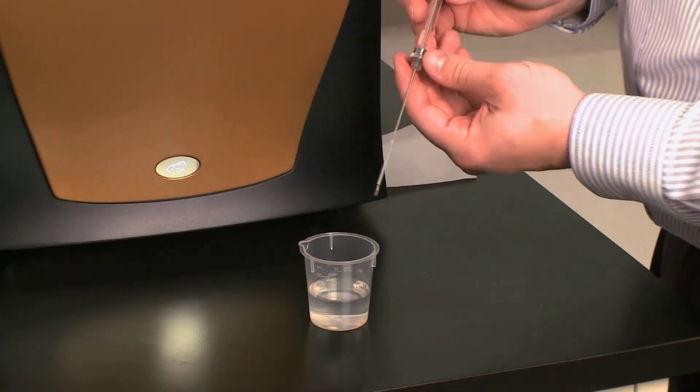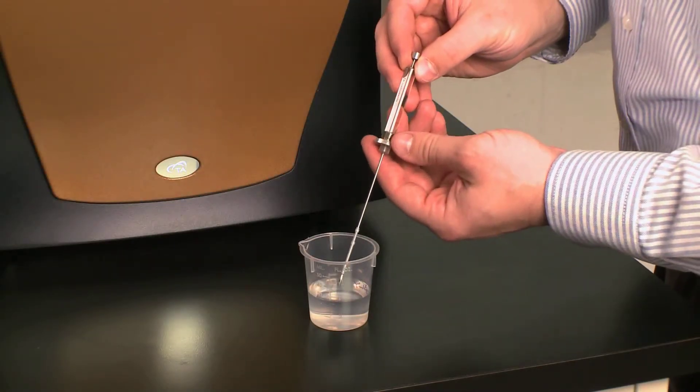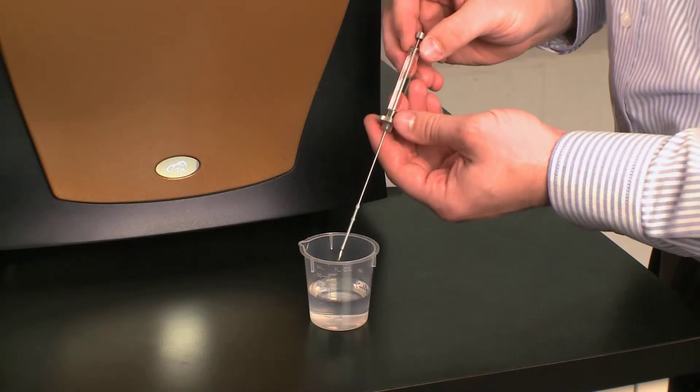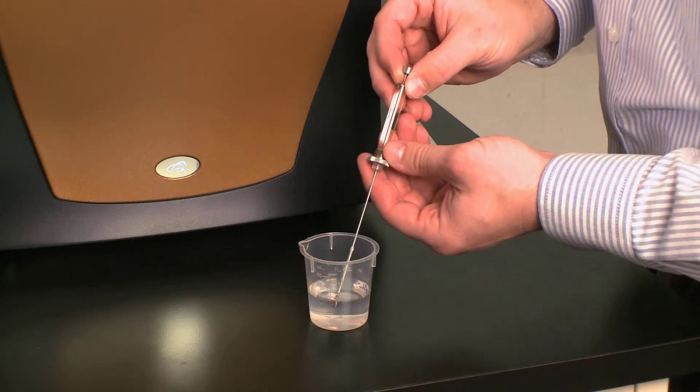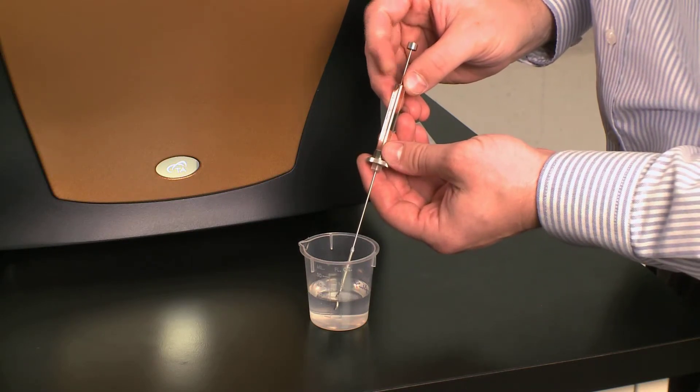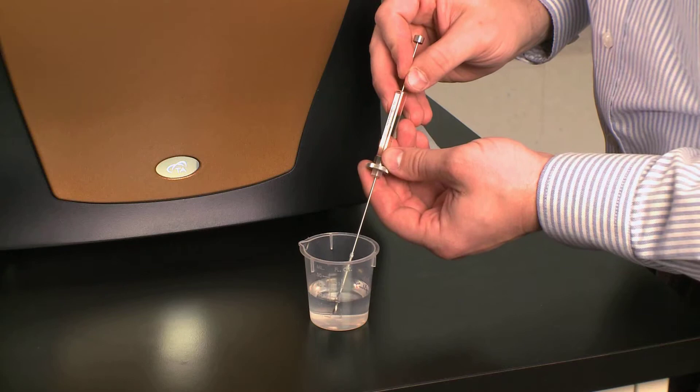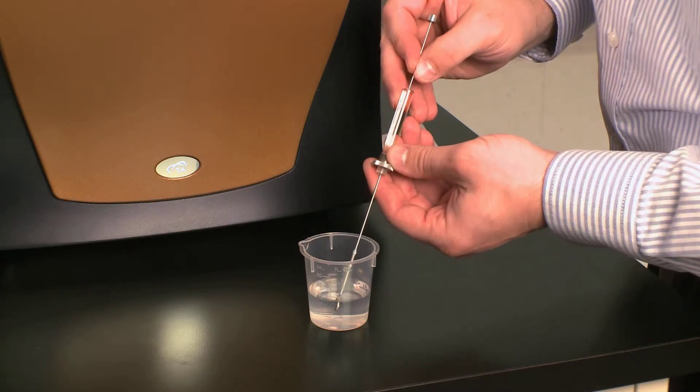I'm going to fill this with water just as an example. So it's empty, it's clean and dry. I'm going to place it in water and slowly take up the water in the syringe.